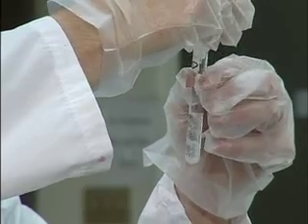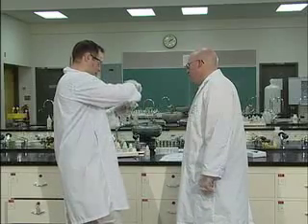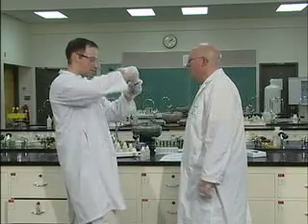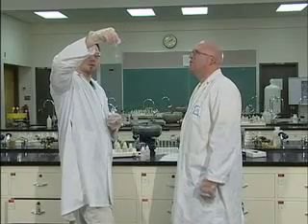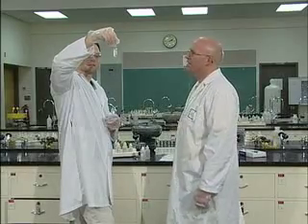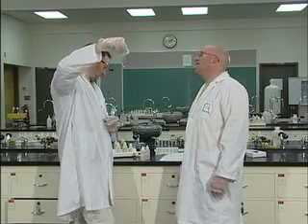Hold on here. All my pretty white stuff's going away. Yeah, you'll notice that all of your precipitate will move back into solution with a couple of quick stirs. Well, that's a drag. It was looking so pretty. It was looking sort of like Christmas.